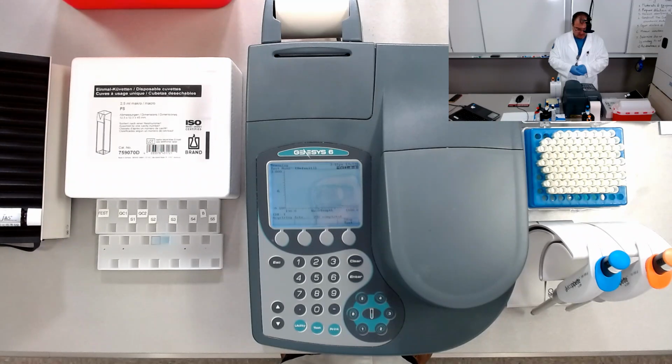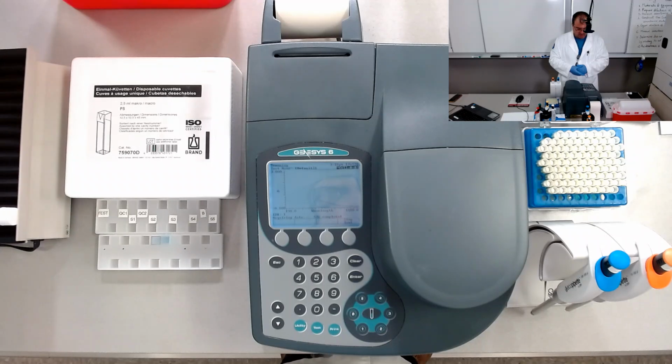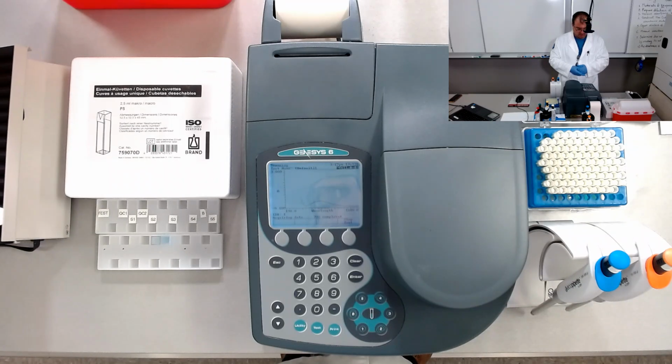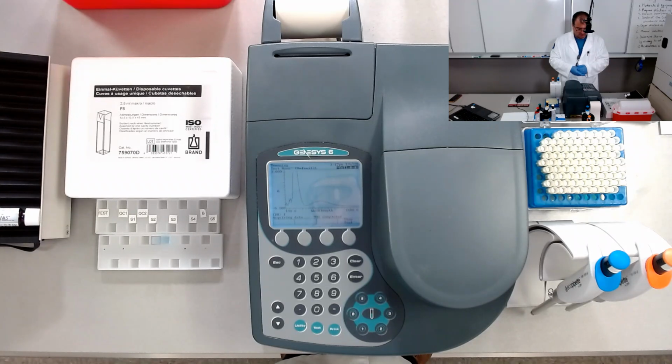So as you can see, the graph goes up for a peak. Okay, somewhere in there. We'll identify later the peak. This one is in UV, looks like in UV, and we are about to finish.